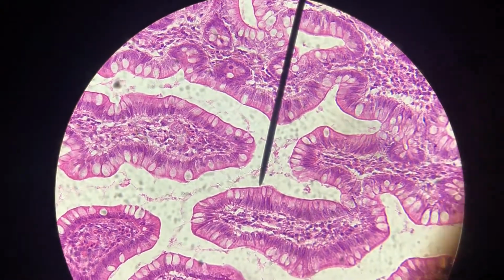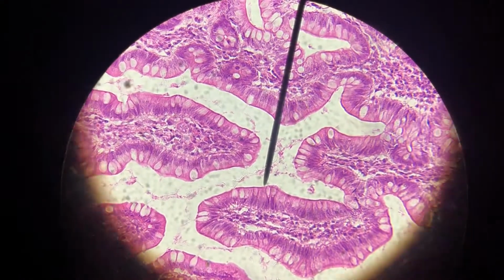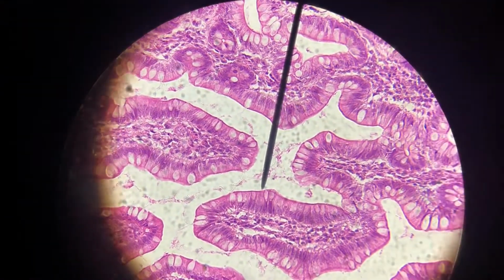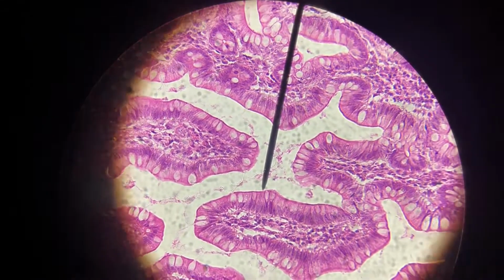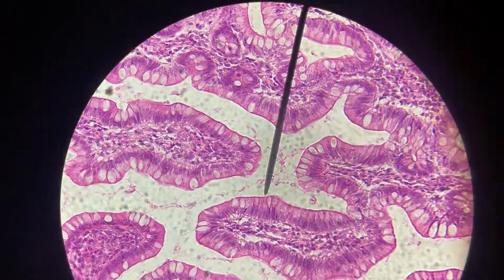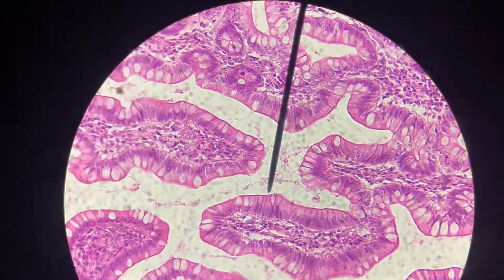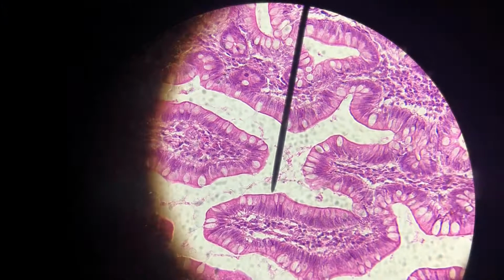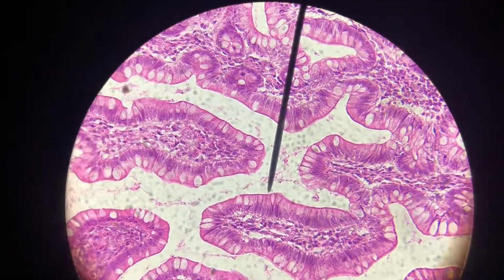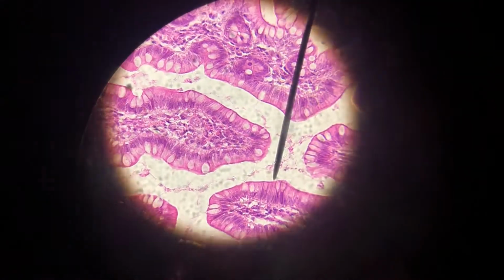So this is a section that's folding on itself. If that's the apical surface, on the opposite side, you can tell this is columnar because we've got those basally located purple nuclei. And then all of the tissue under that is that lamina propria, which is the areolar connective tissue that serves our mucosae. So that's simple columnar epithelium. We only have one more simple epithelial tissue to look at.